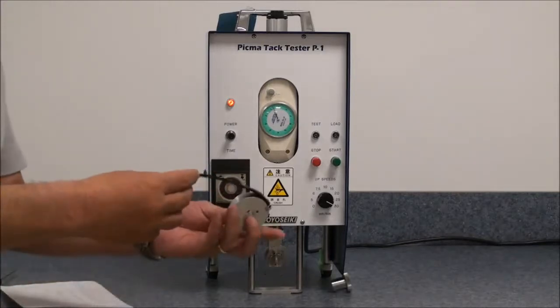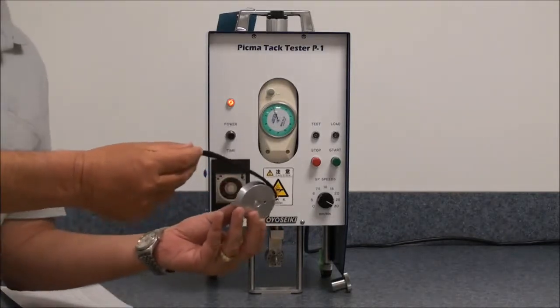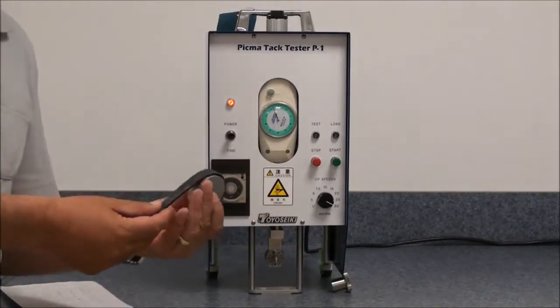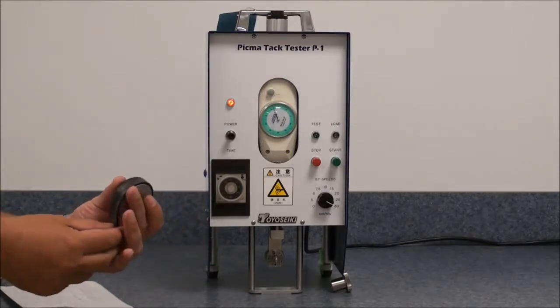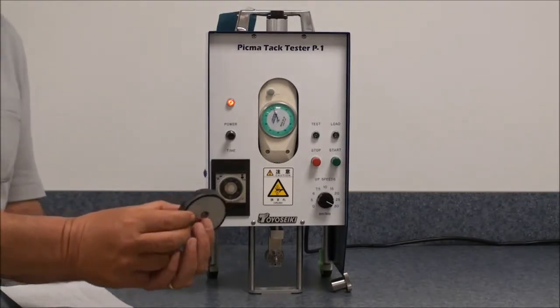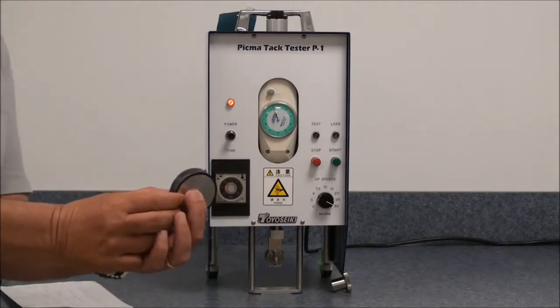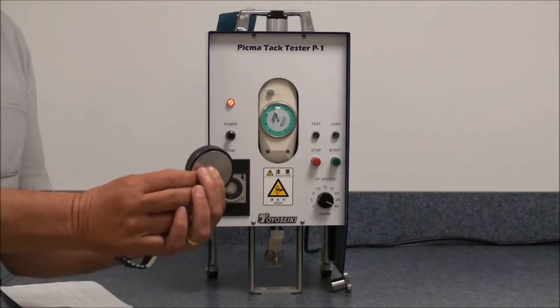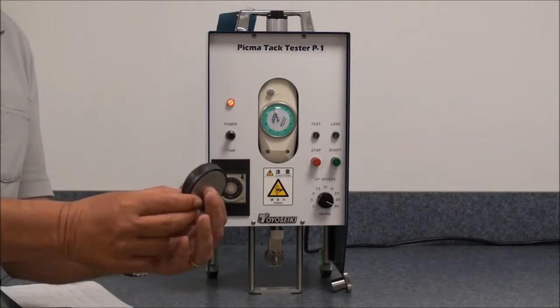The first thing the customer must do is apply his sample to the sample holder. Samples are 12.7 millimeters, half inch, by 152 millimeters, which is six inches.